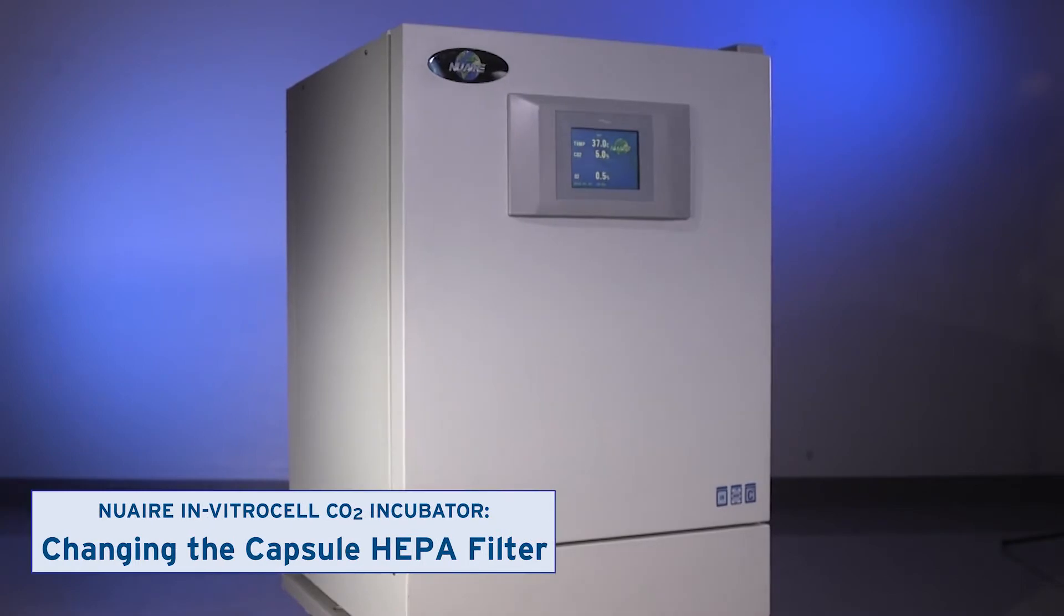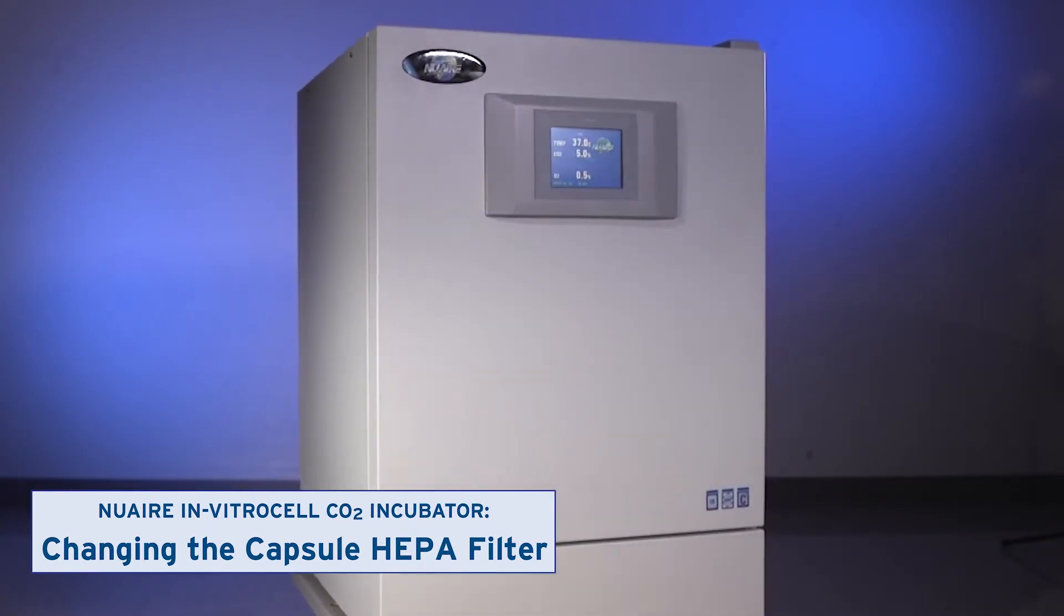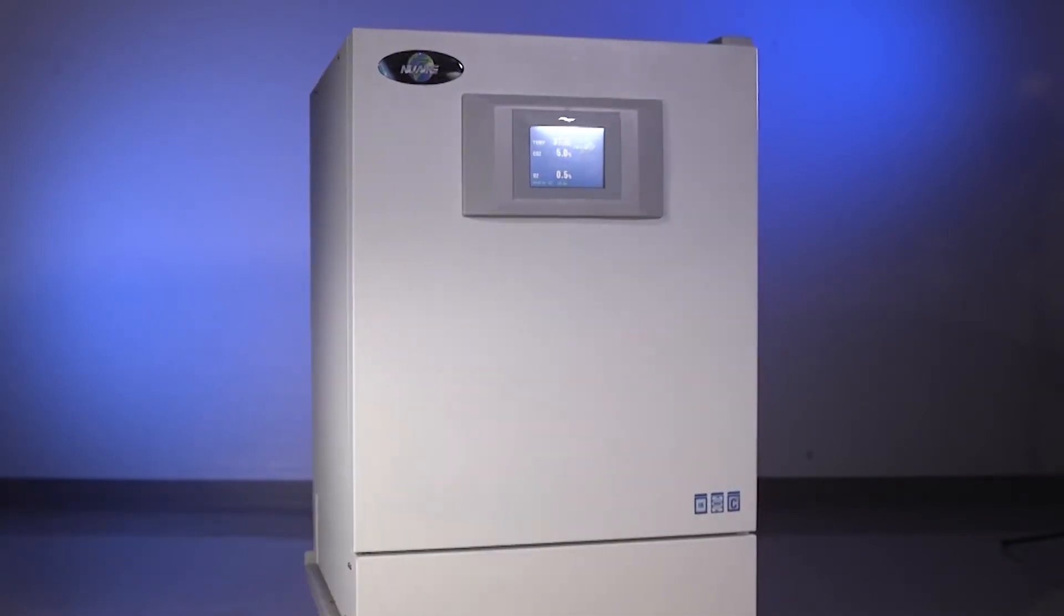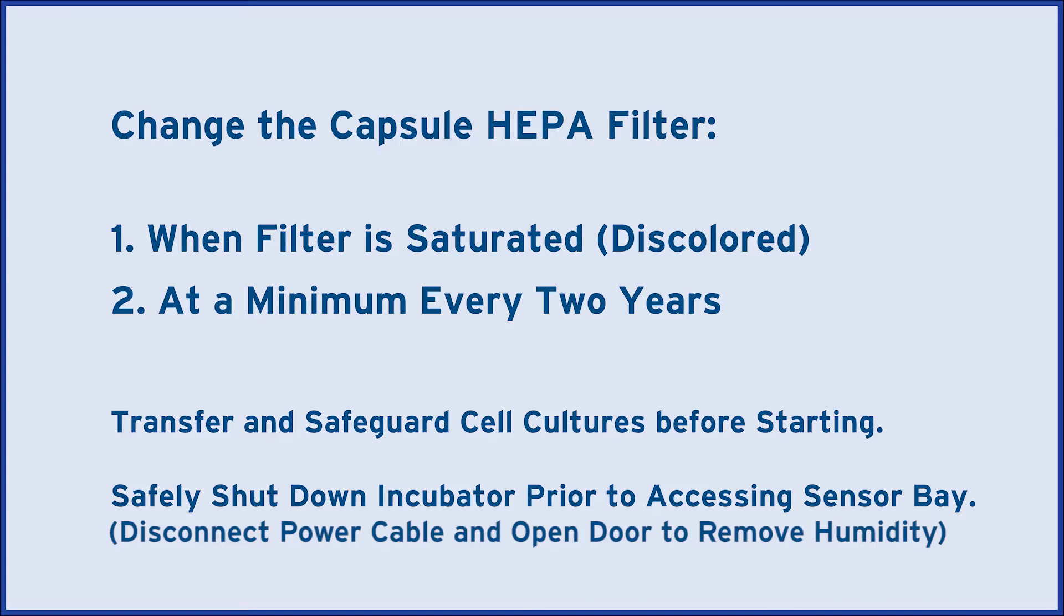This video shows how to change the incubator's capsule HEPA filter. This filter protects against contaminants as well as moisture and should be changed every two years or when saturated. It is best practice to inspect the filter every six months.